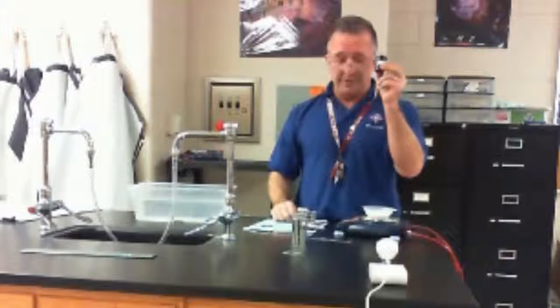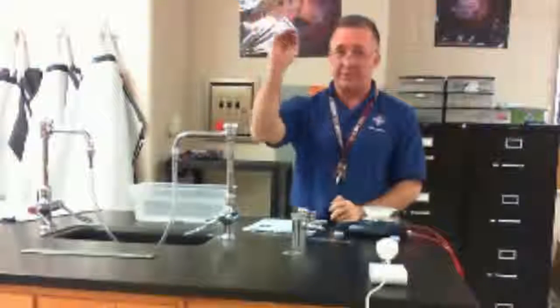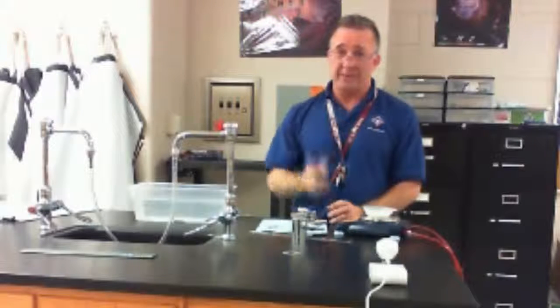All right, so go ahead and do that, and then at the end of class, you can tell which student came in first, second, third, etc., and then you can decide what your grading scale is based on that. So it's a lot of fun. Give it a try. It only takes about one period, and it gets the students involved in the experiment.